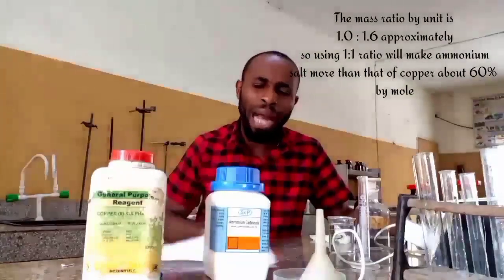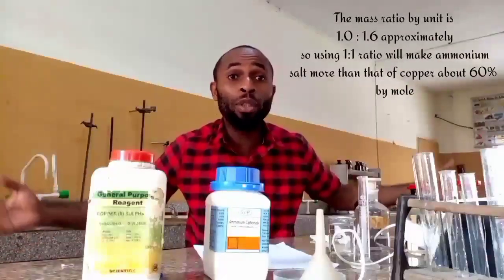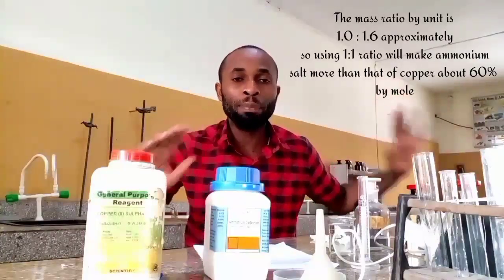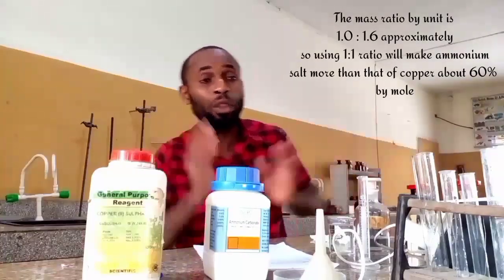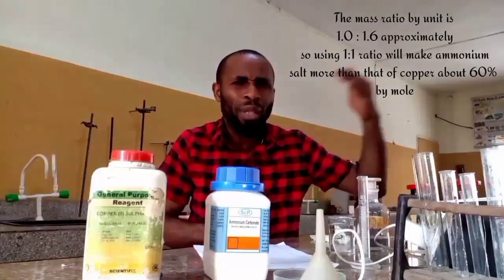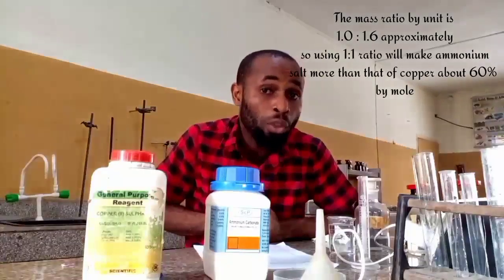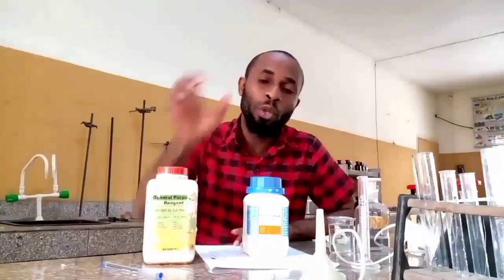And I know you may be having a problem with how am I going to measure this. To be frank with you, you can actually do this without even using measurements. We can just use our spatula full. A spatula full of this against a spatula full of this can do the work we want to do, and that is what I am going to use. There is no need of making use of the weighing balance, but you can still make use of the weighing balance if that is what you want to go for. But no matter how you go for the weighing balance, you are still not going to be all that accurate as you expected. Therefore, I am going to take 1 spatula full of this, also 1 spatula full of this.